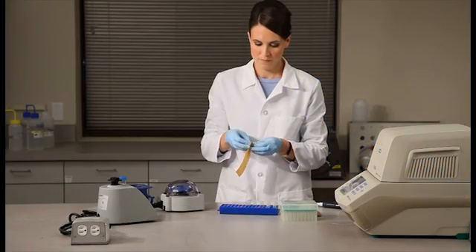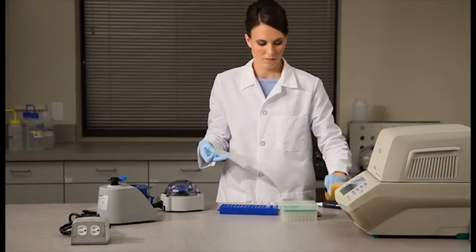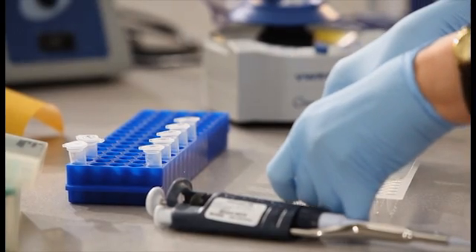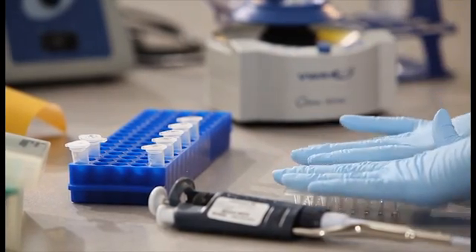The next step is to seal the plate. Place an adhesive seal on the top of the plate. Apply pressure to ensure that each well is completely sealed.